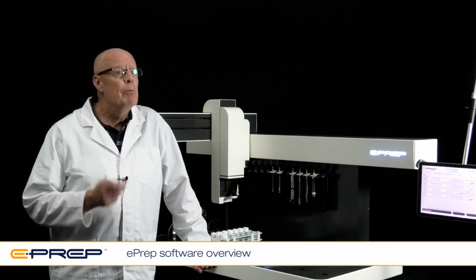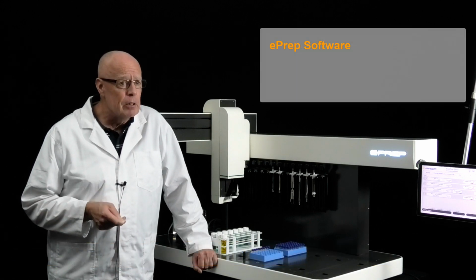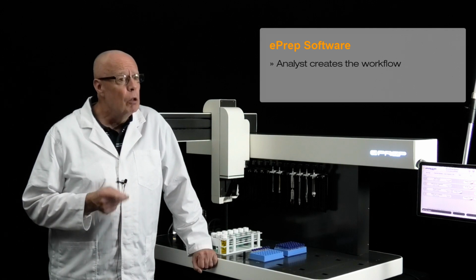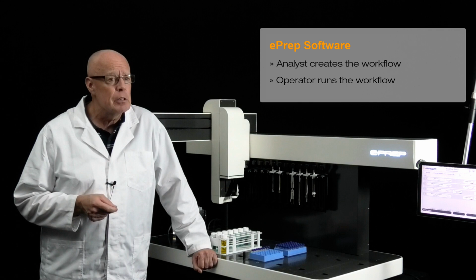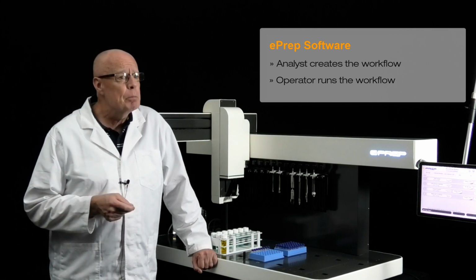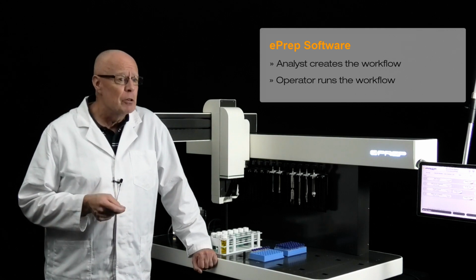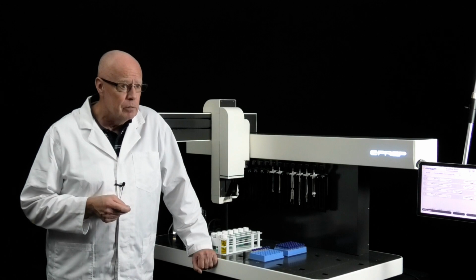A typical lab workflow is where an experienced analyst usually sets up the method and then either runs the method themselves or, more likely, passes it on to an operator for day-to-day sample processing. So once the method has been set up, the person running the samples doesn't need to know the details of the method, but certainly needs to know how to run the sample set.